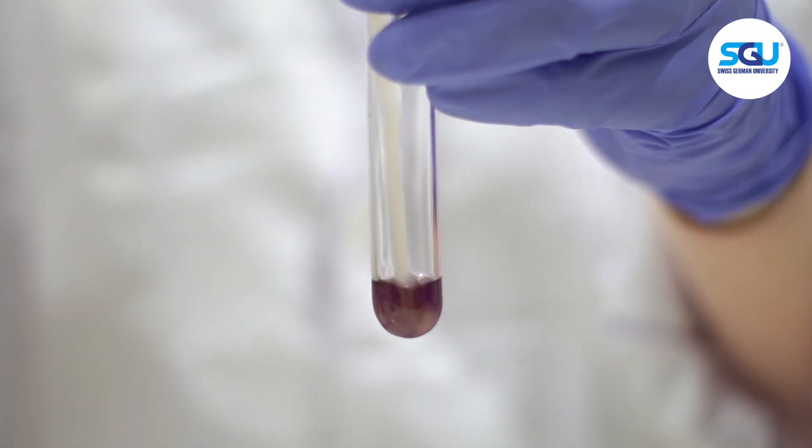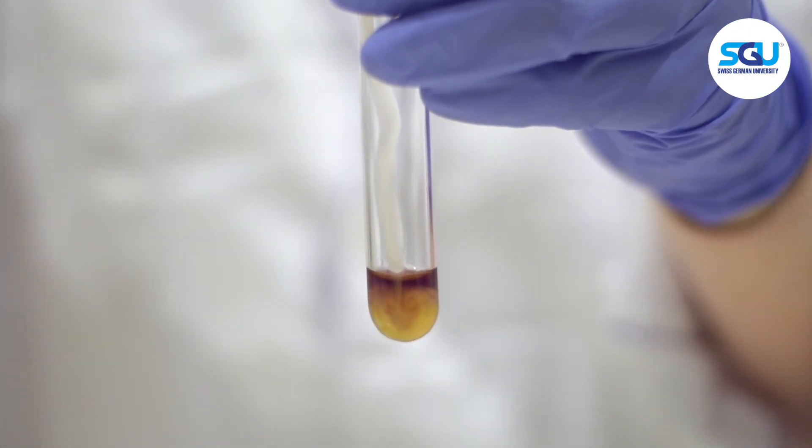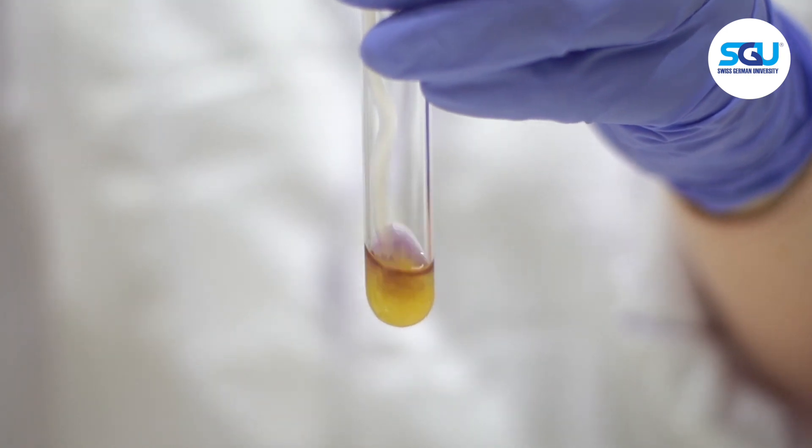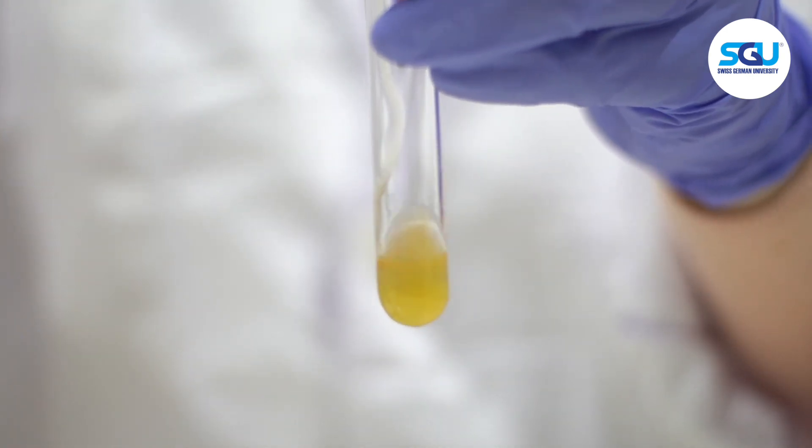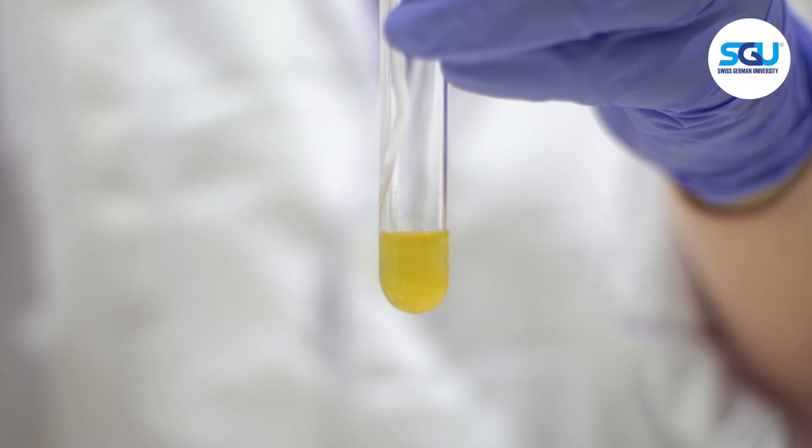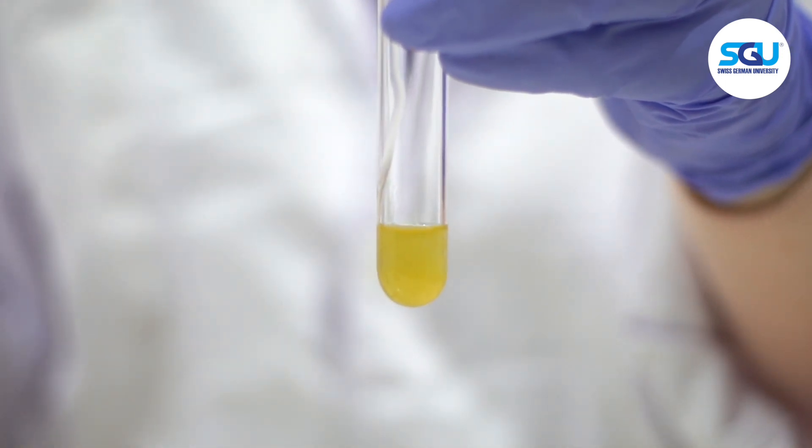Into the DPPH test tube, the orange sample was added. The purple color of the DPPH turned into yellow, indicating the qualitative antioxidant activity of the fruit juice.